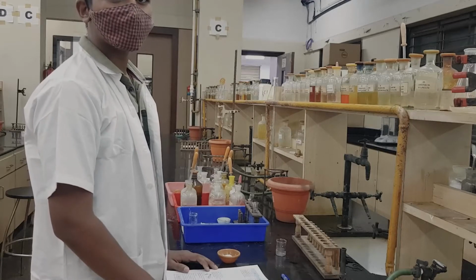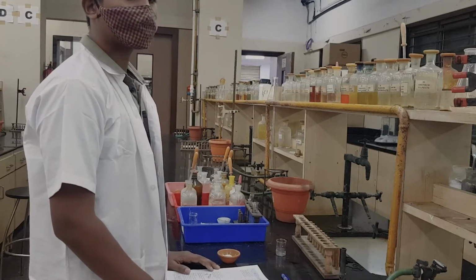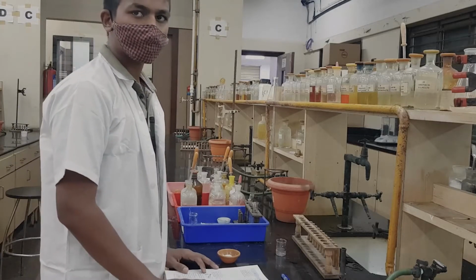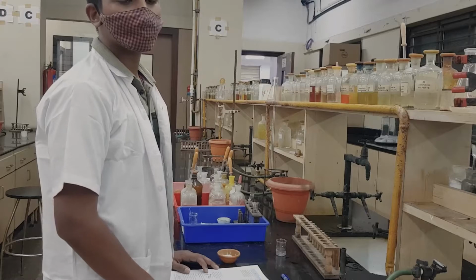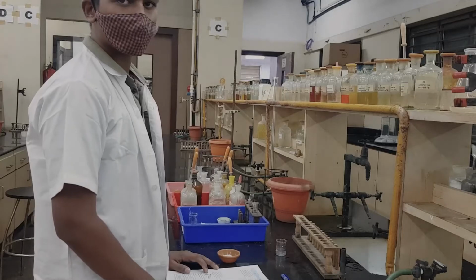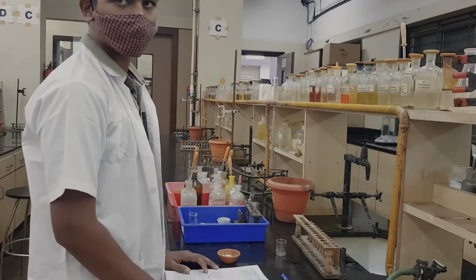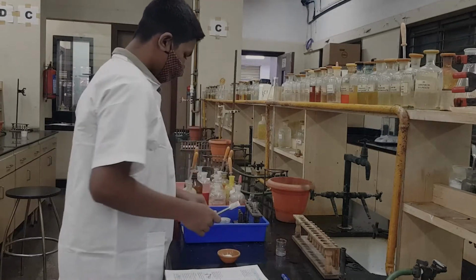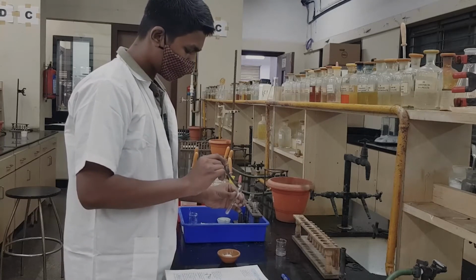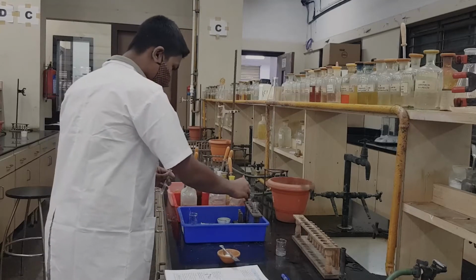You will write down the corresponding inference referring to your handbook. Now coming to test number 3, the NaOH test. In this test you are checking only for the ammonia smell, because it is done for only one radical, ammonium, so you do the test directly with the mixture. You take a test tube, take a little bit of the mixture using a spatula, and add dilute sodium hydroxide solution.